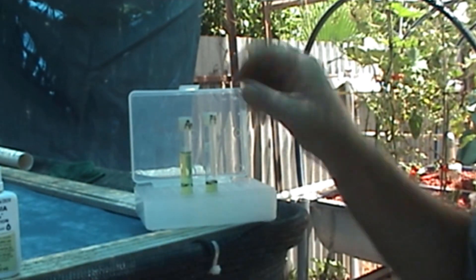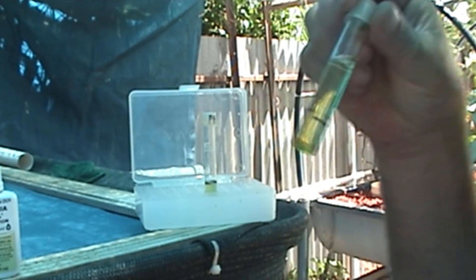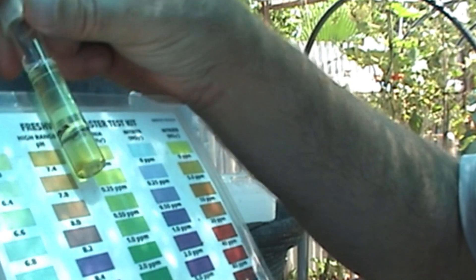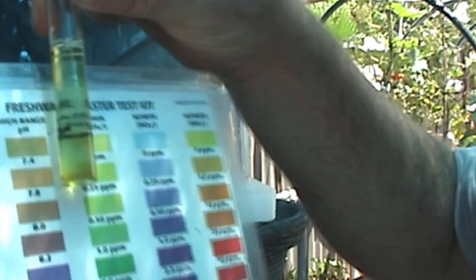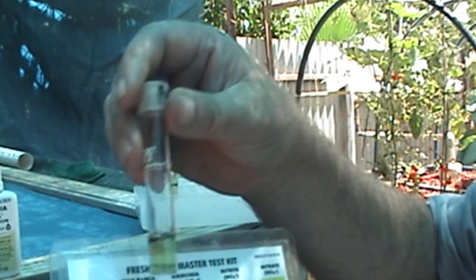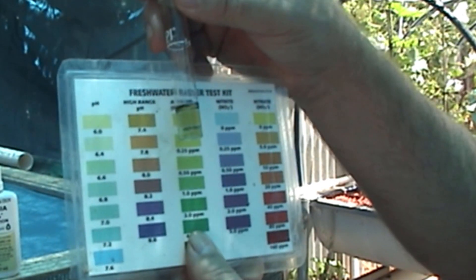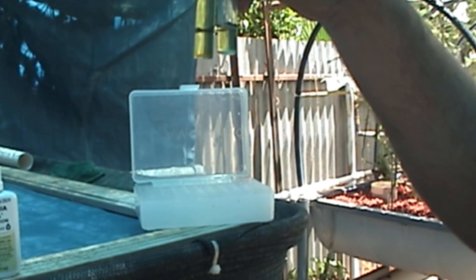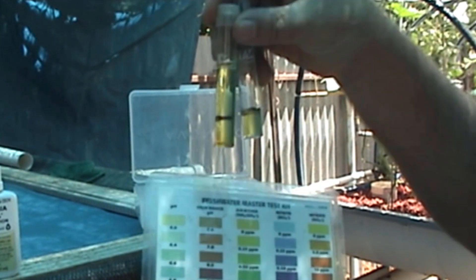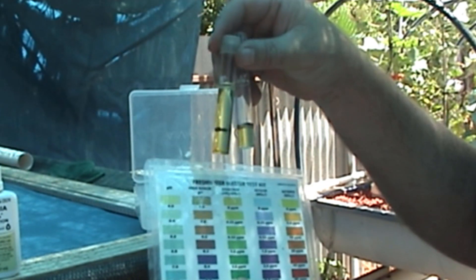Okay folks, it's been 5 minutes. This is your normal range test for ammonia. As you can see, we're reading pretty close to 0.25, in between 0 and 0.25. That's your normal up to the white line test. Now this is your adjusted test. And we're reading the same, 0.25. As you can see, the color is exactly the same. There's no difference in color. That's your ammonia test and that's how you reduce it to make it last longer.